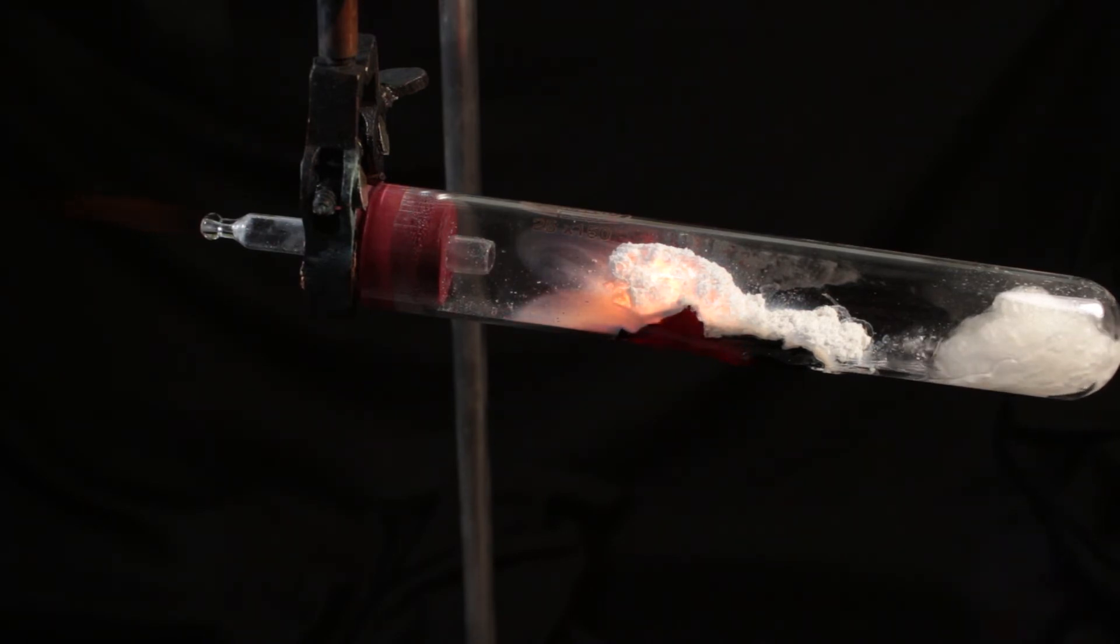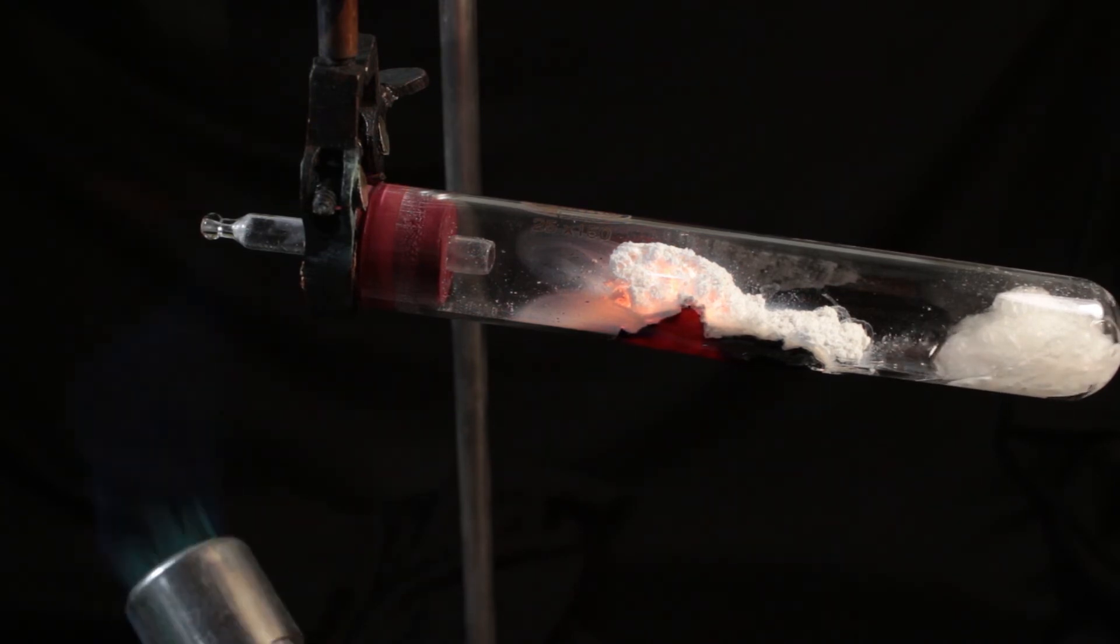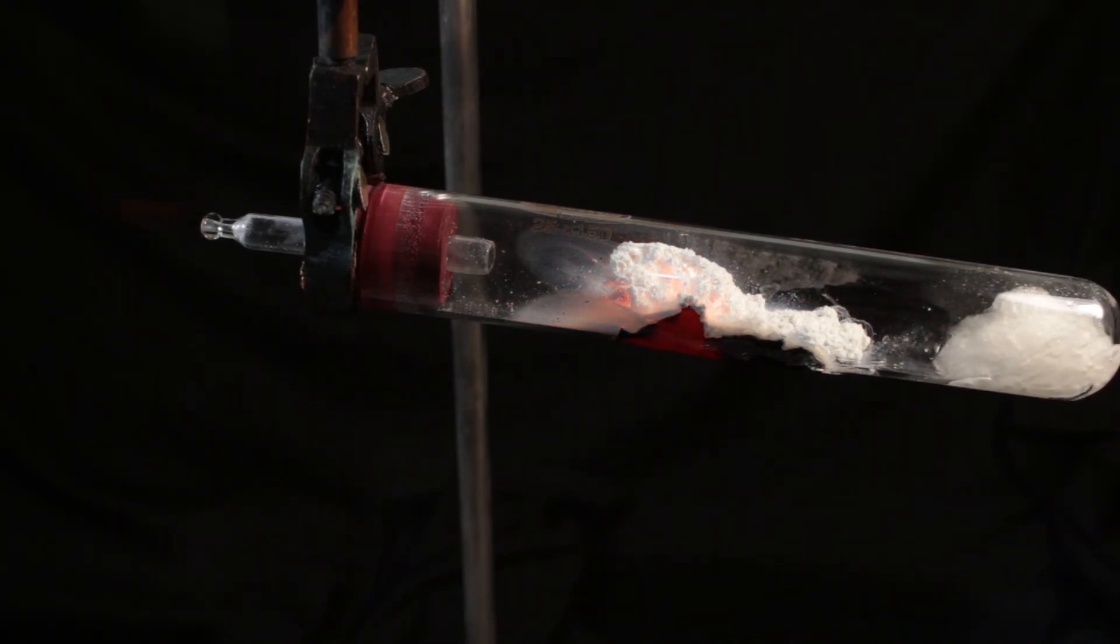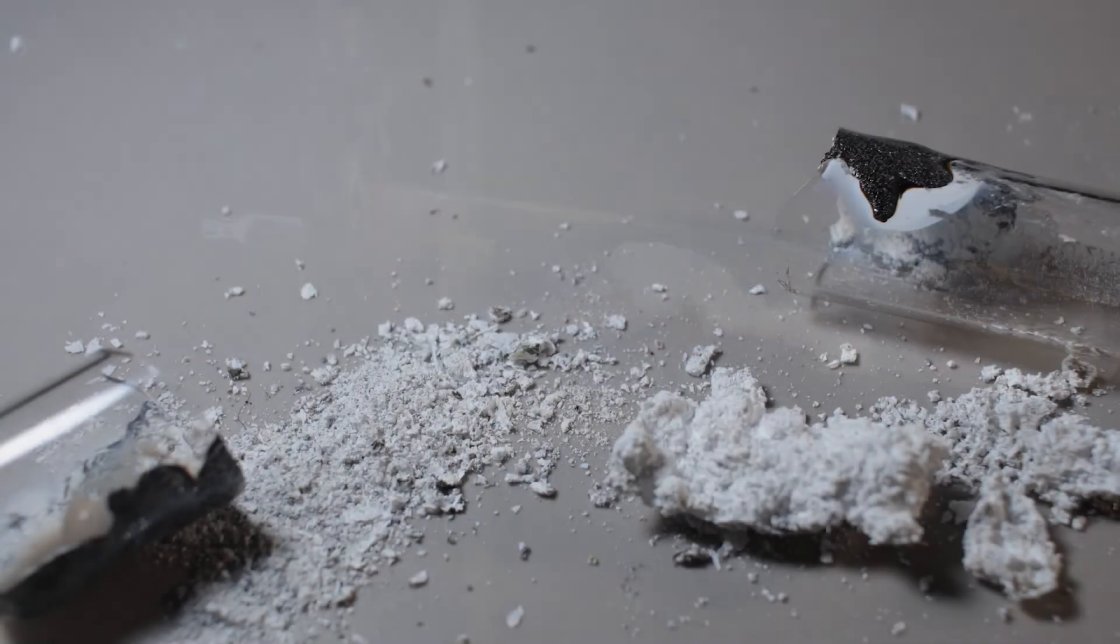But it looks like that magnesium is used up. Any more hydrogen? Nothing. Reaction is essentially stopped. Test tube is destroyed. There are some cracks in it and you can just take it open.